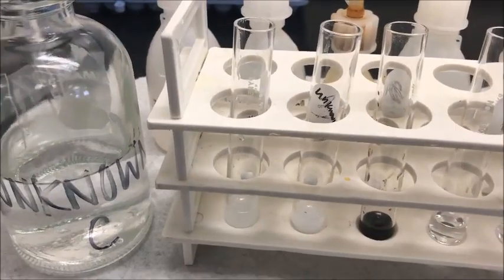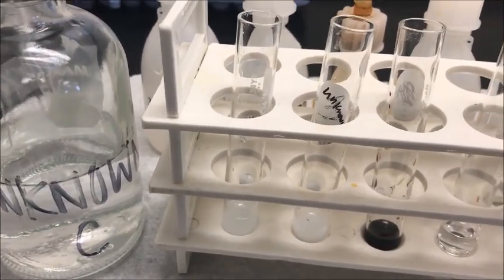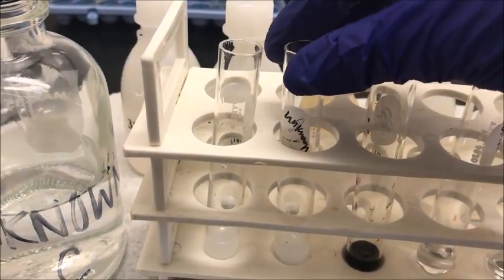From these results, unknown C tested positive for calcium ion and carbonate ion.